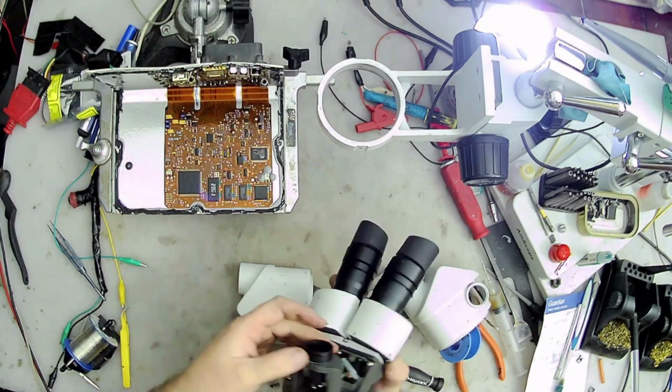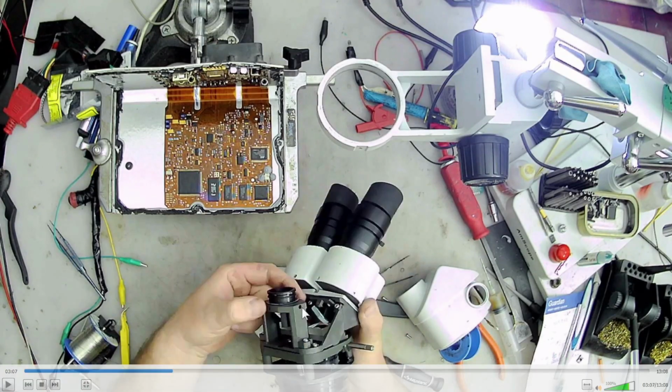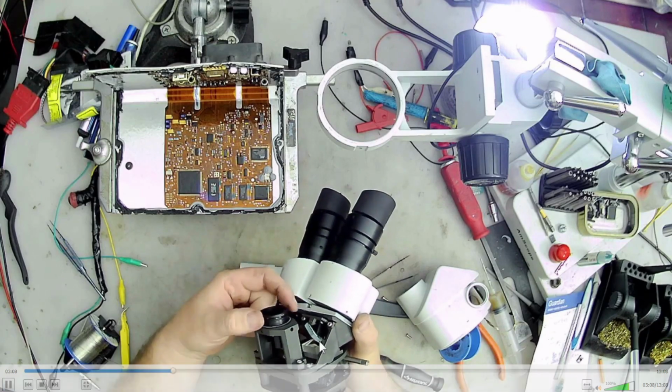And then we can see a better picture of all the set screws. So we ended up having four set screws. We had one in the front, one in the back, and then one on each side. And they're all the same size. And they're the same size as the little magnification knobs and this part of the camera port. It's all that same small one.